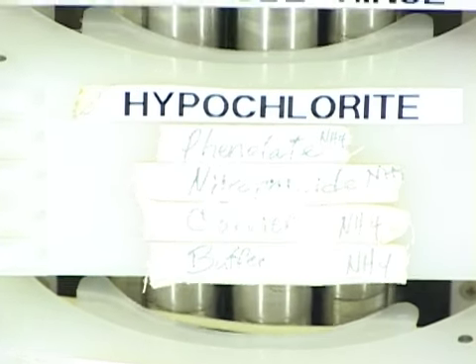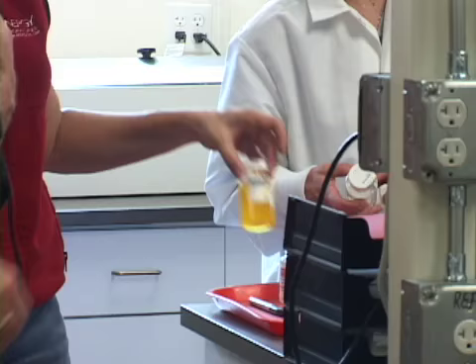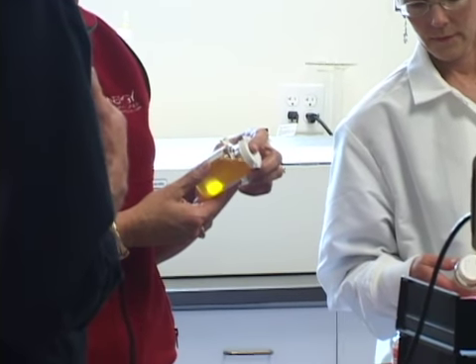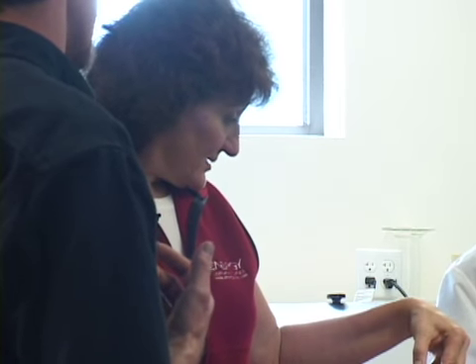What is the third category that you mentioned? The third category is nitrates. They are toxic at a high enough level. When we received your sample today, we took that sample and we poured some of it off, and we actually added an acid to it to preserve it for the nitrate test so that the sample would not change until we could perform the test.